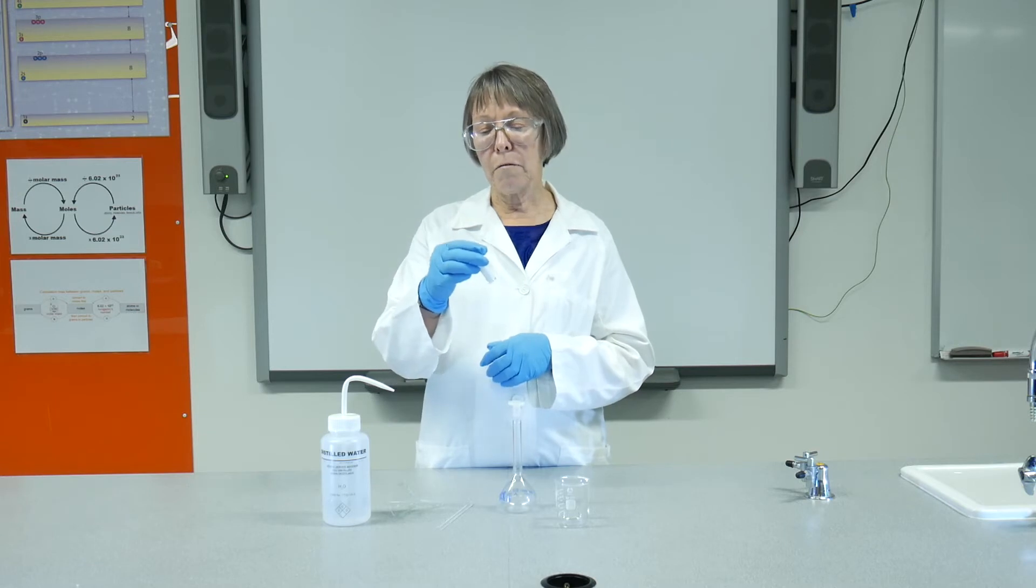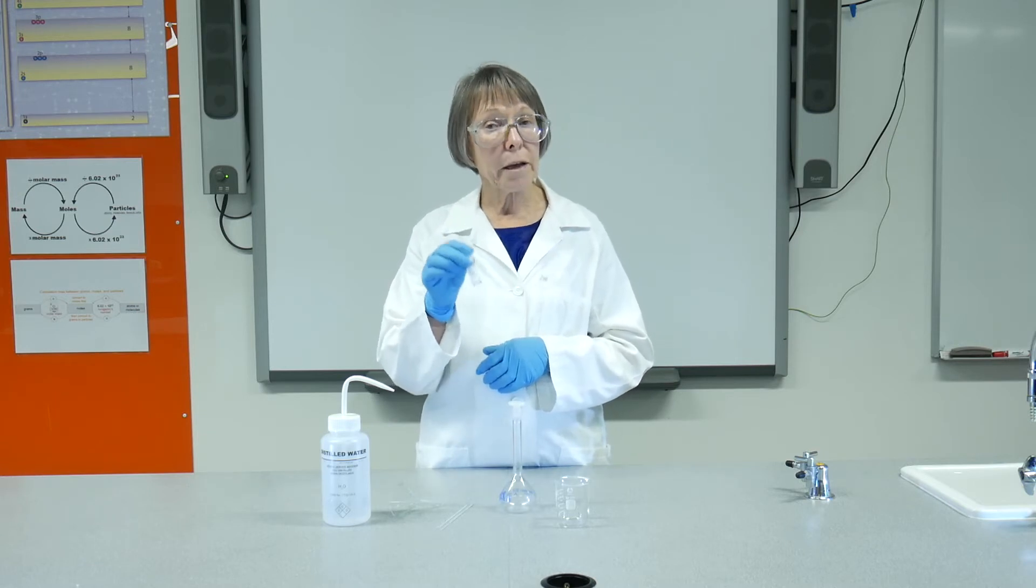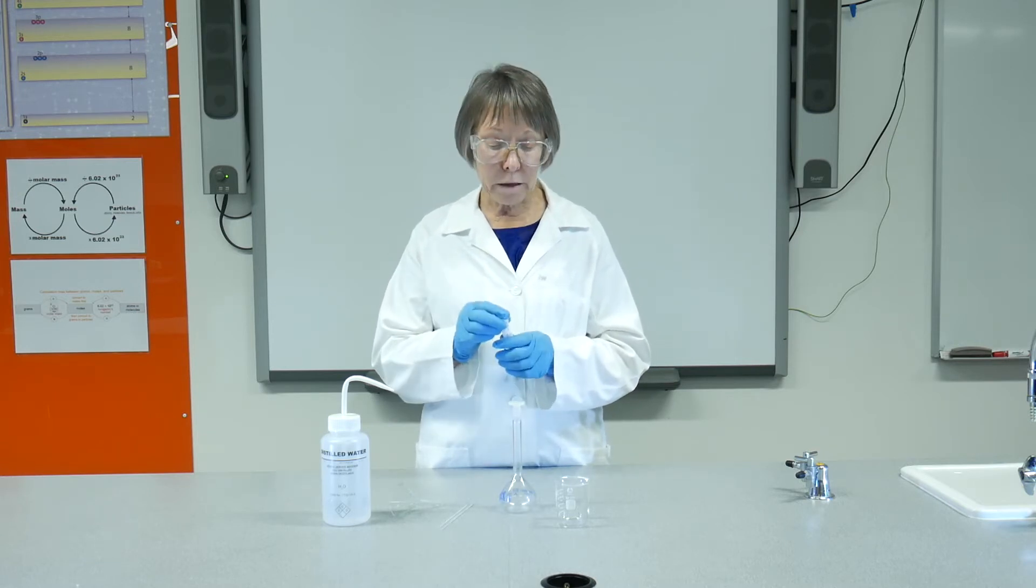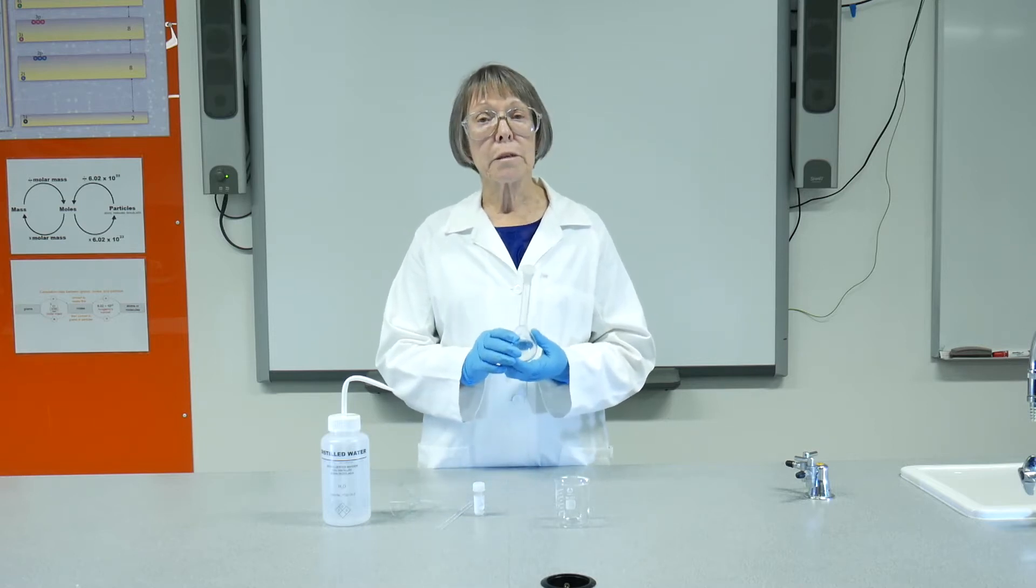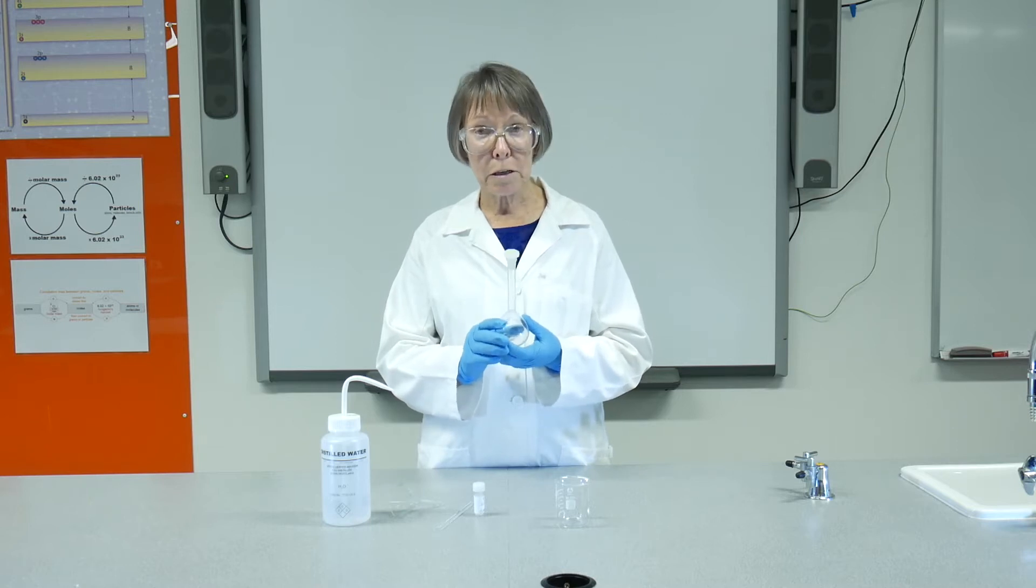I have roughly 0.4 of a gram of it here that has been weighed on an analytical balance, which I'm going to use to make up a standard solution of around about 0.02 moles per litre concentration.